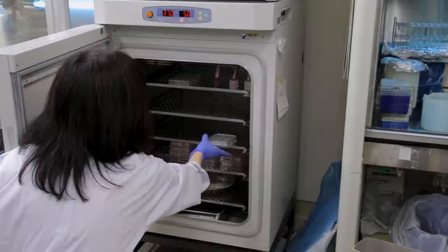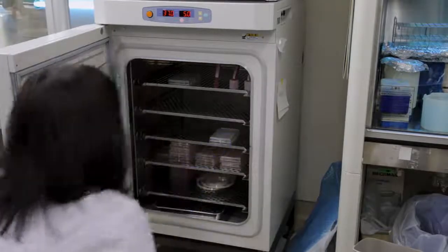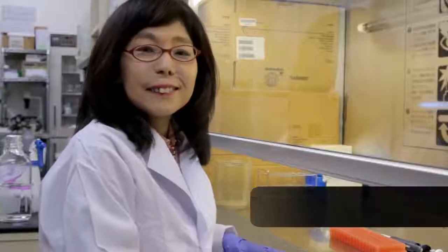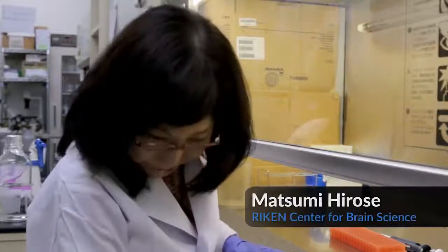We believe that our method has the potential to be expanded to the dissection of calcium signals at subcellular resolution in living animals in the future. Helping to demonstrate the procedure will be Matsumi Hirose, a technician from our laboratory.